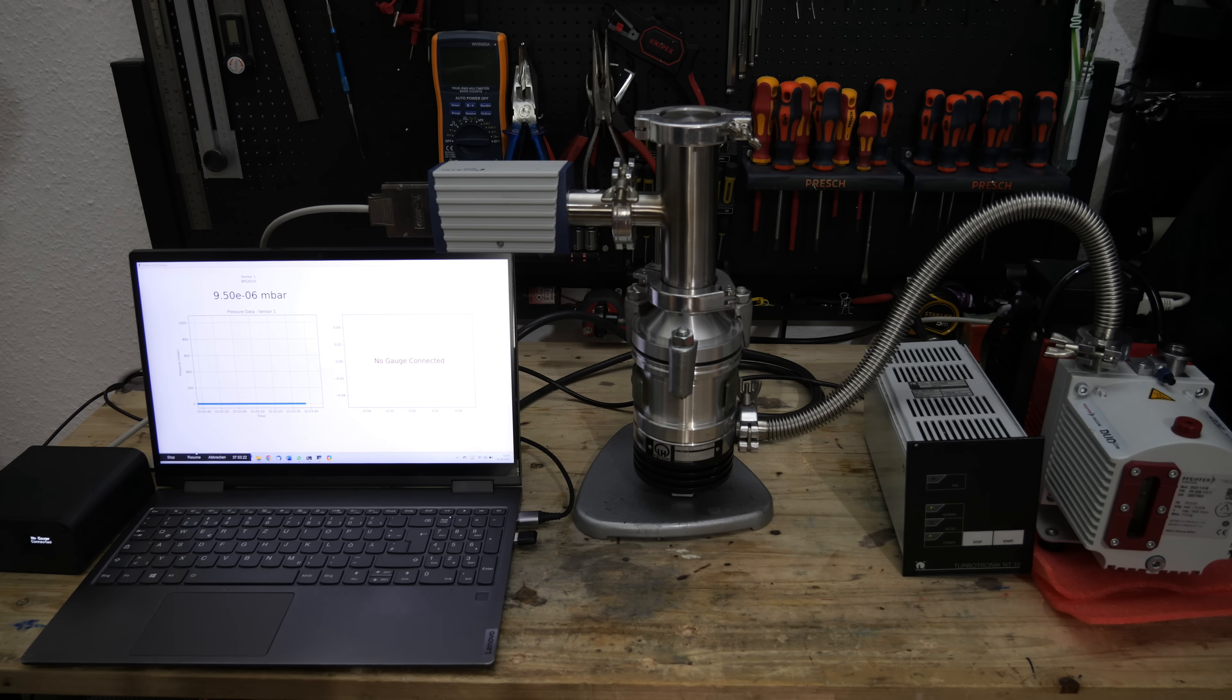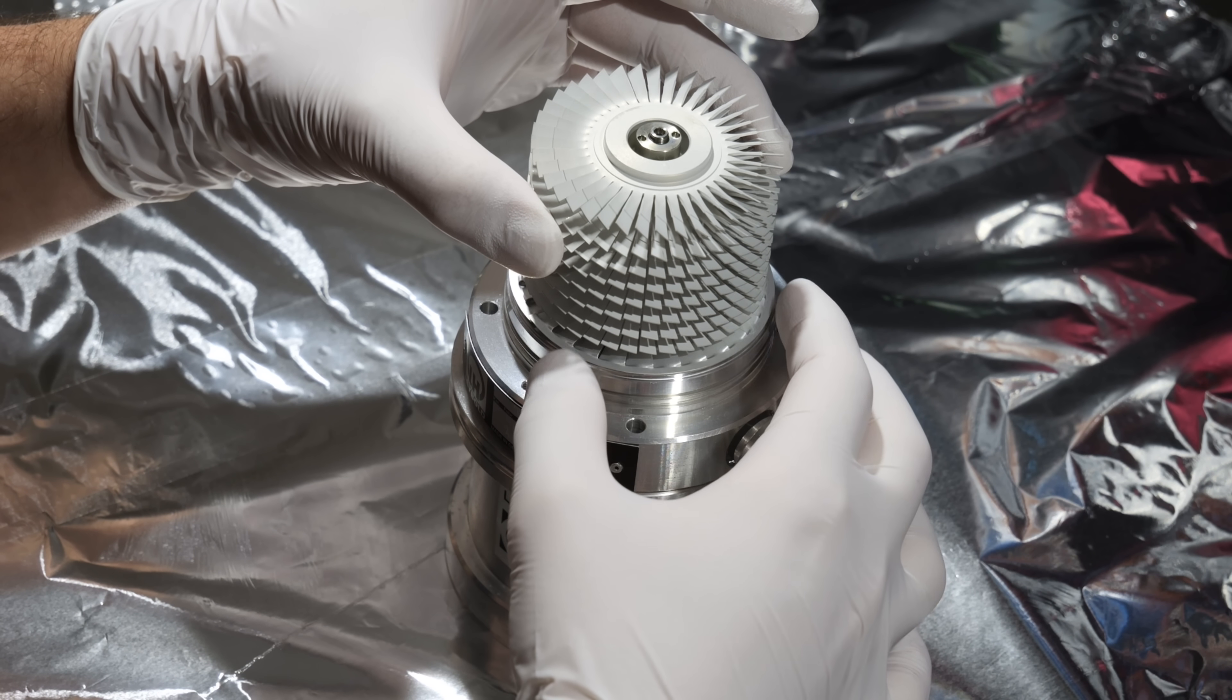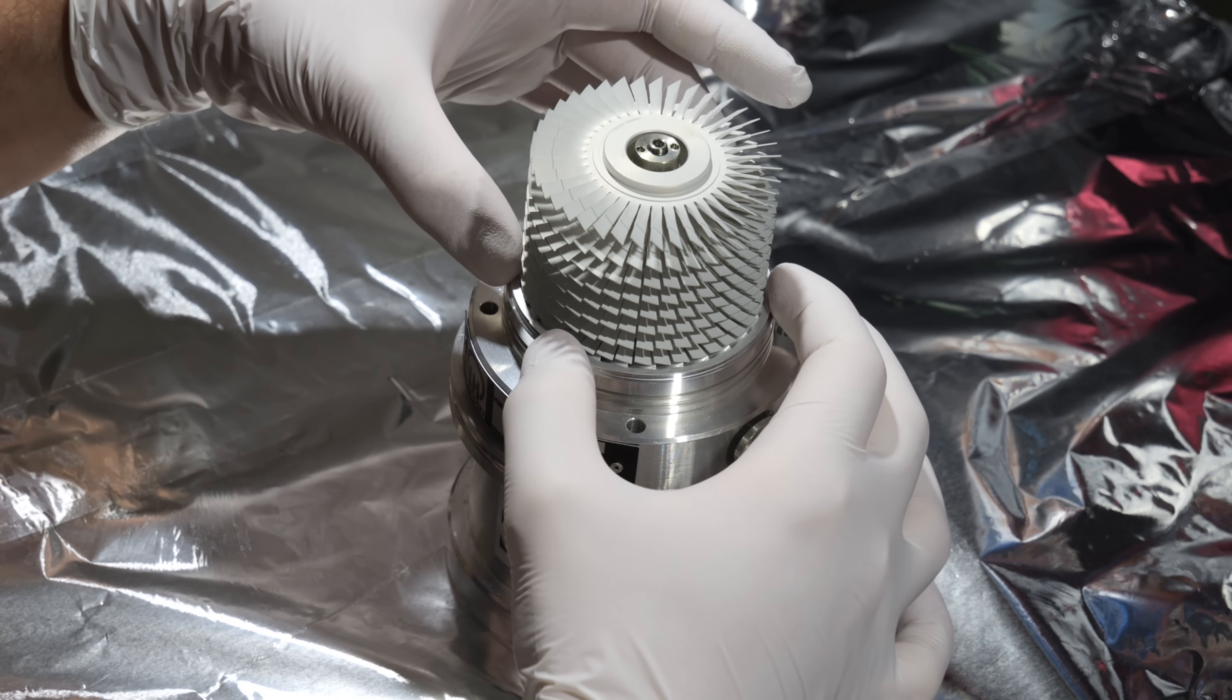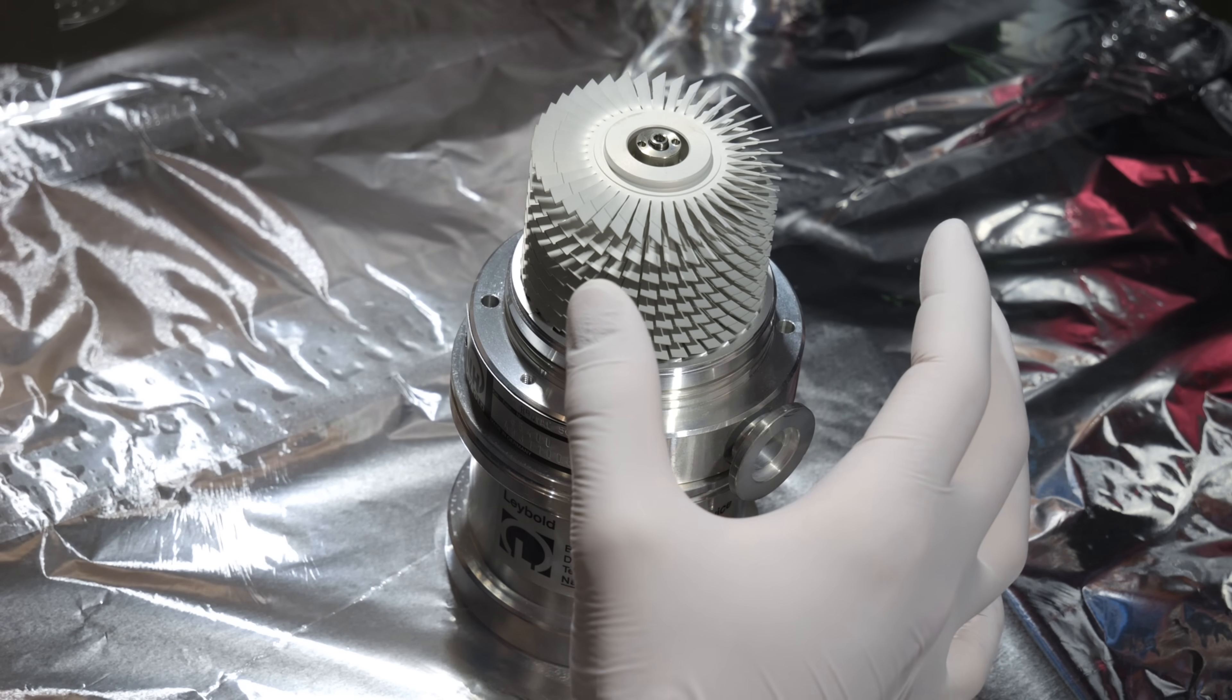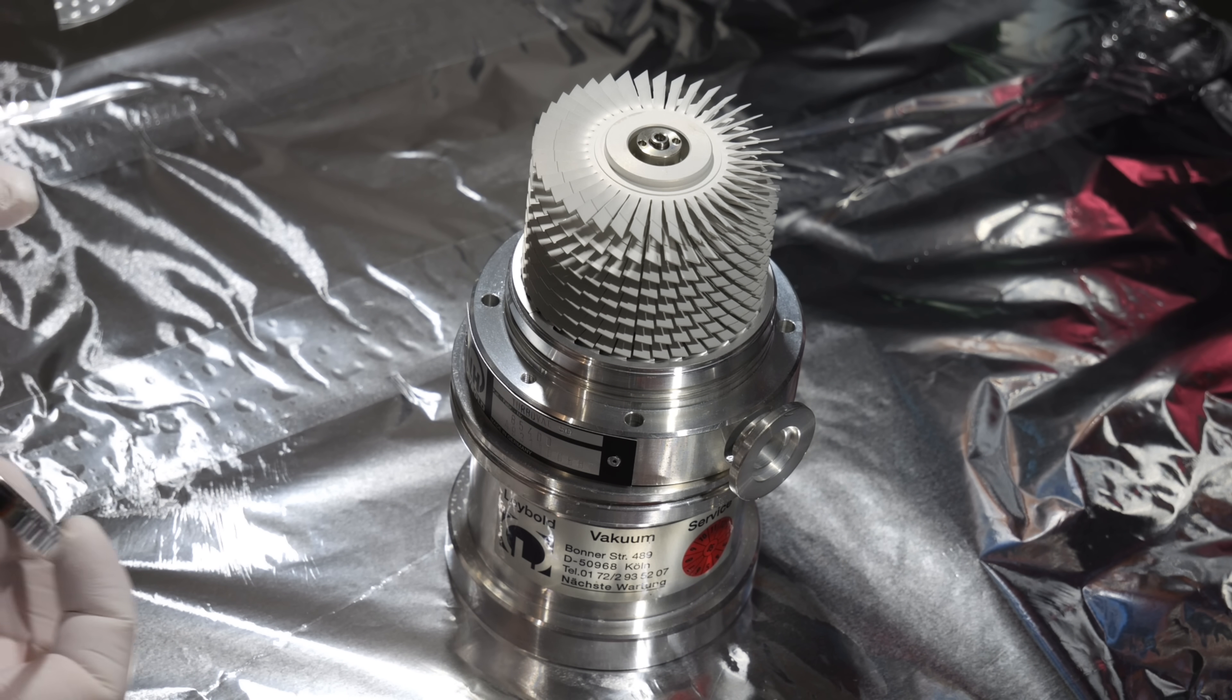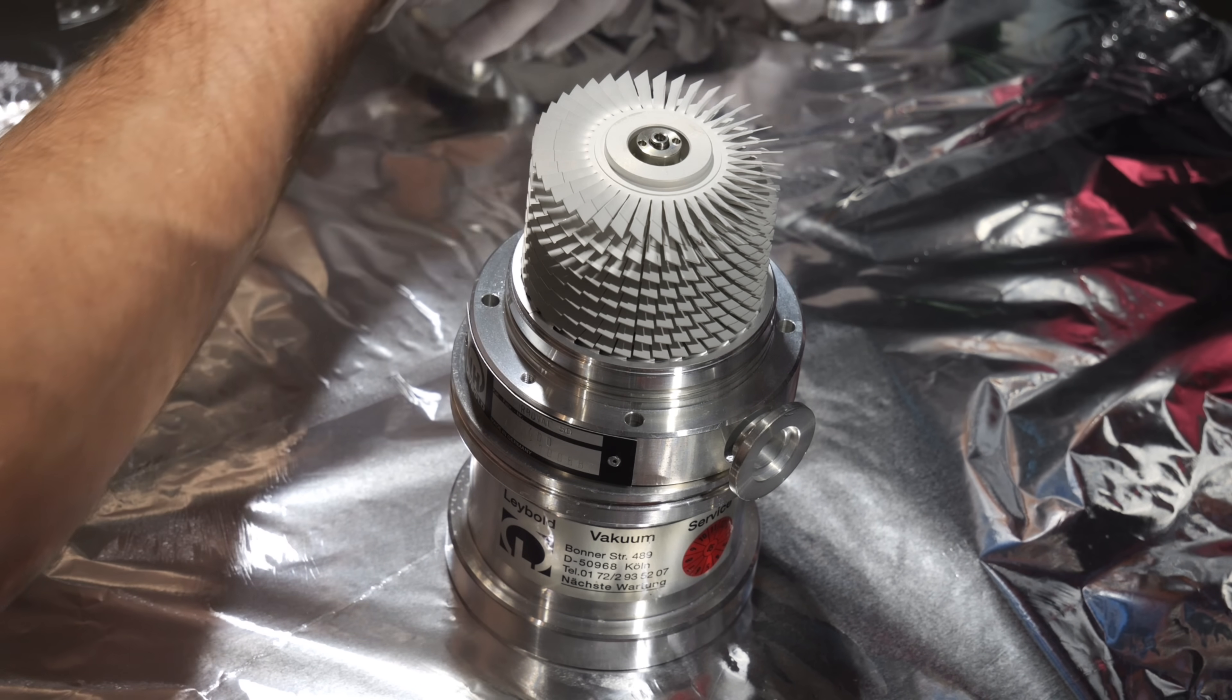And yes, other than that, thank you a lot for watching. A small note while editing the video. After the pump ran for a while and then stood for a bit, you can once again perceive an oily smell, albeit much fainter than before. Nevertheless, I will likely disassemble the pump again and attempt to fully dismantle the rotor. I suspect that old oil or grease might be present in the ball bearings and slowly disperses when the pump is running. Whether this attempt will be successful will be revealed in an upcoming video.